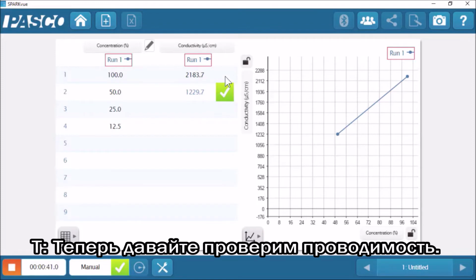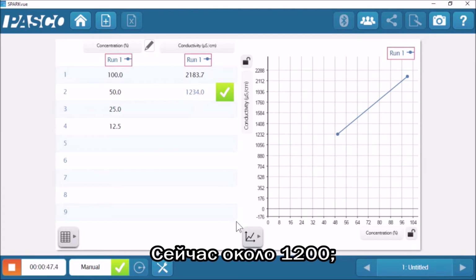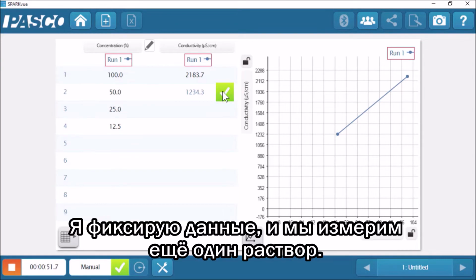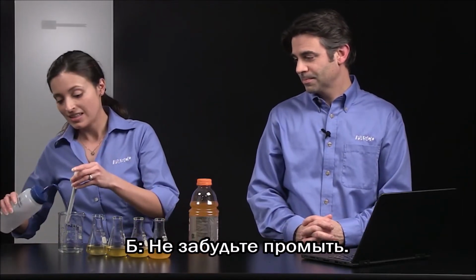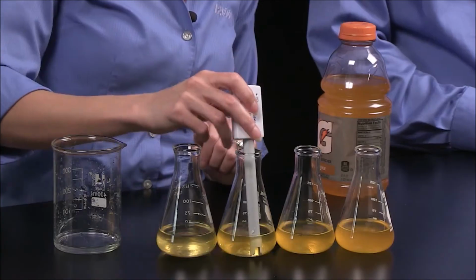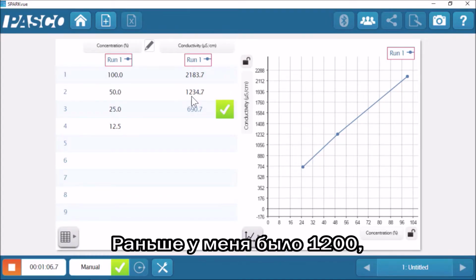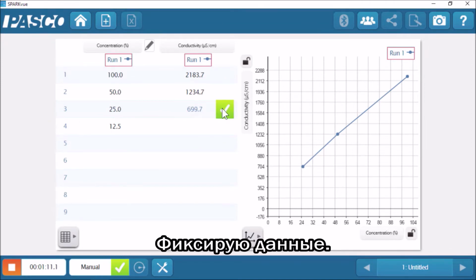And now let's check the conductivity. So it was originally around 2,200 microsiemens per centimeter, and now it's around 1,200. So 50% dilution, about half the conductivity. I'm going to hit check, and we'll try another one. Okay, remember to rinse. And again, it was diluted, half water and half of this solution. So now we're down to 25%. And now I was at 1,200 before, and now I'm around 600, 650, 690. And I'm going to hit check.